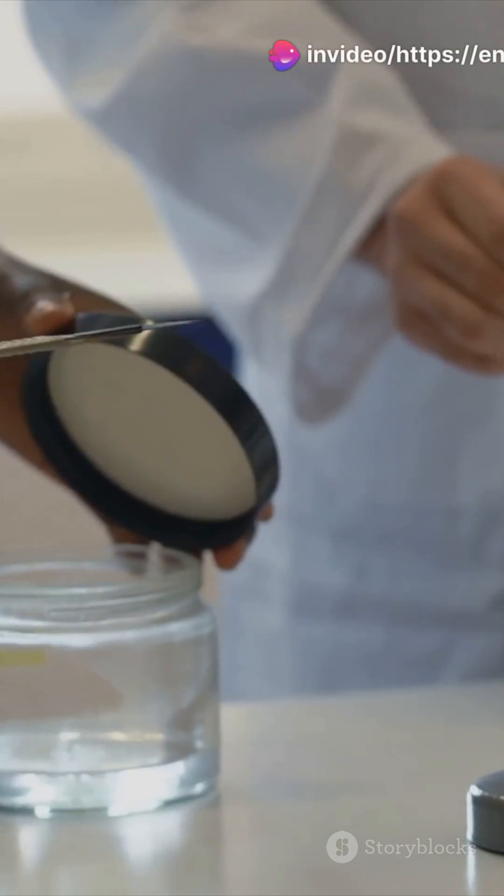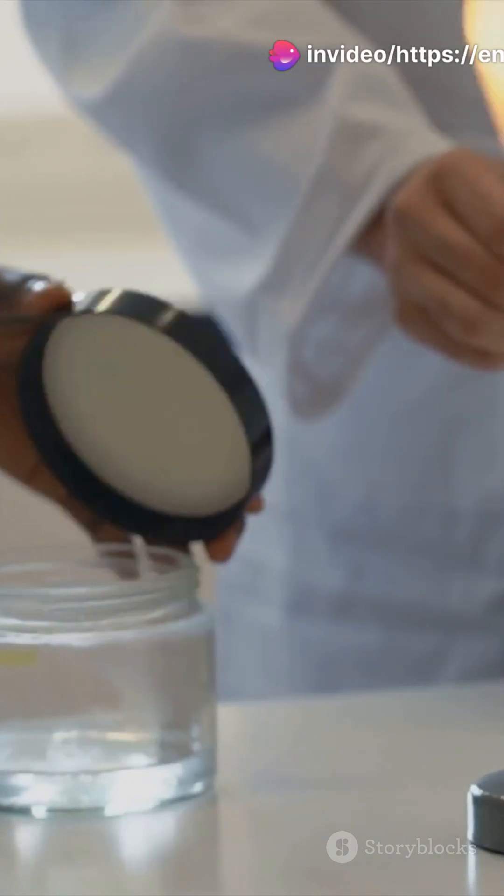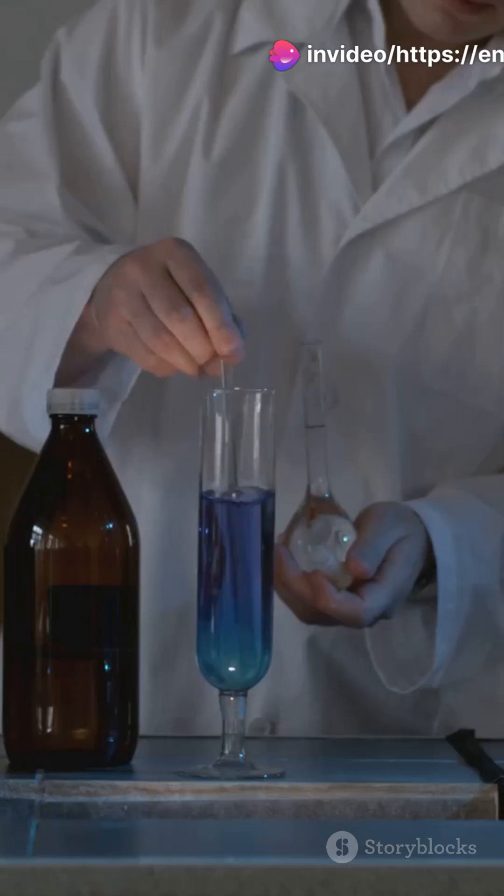Am I the only one that didn't know you could measure water clarity with a candle? Turns out it's pretty cool.